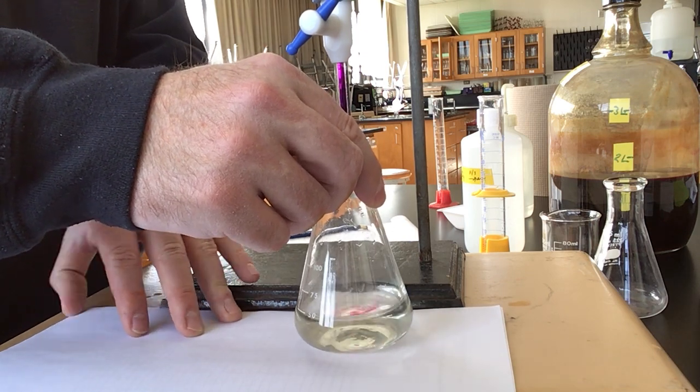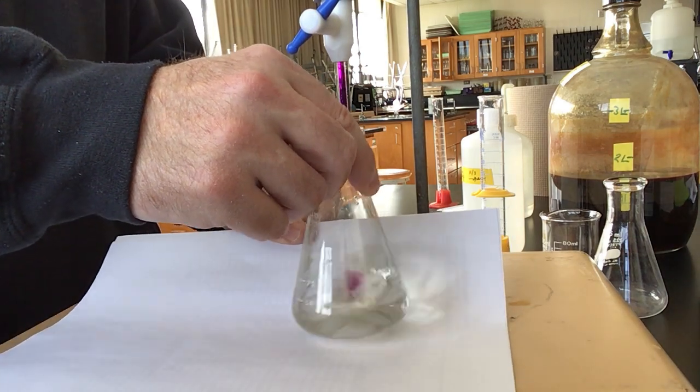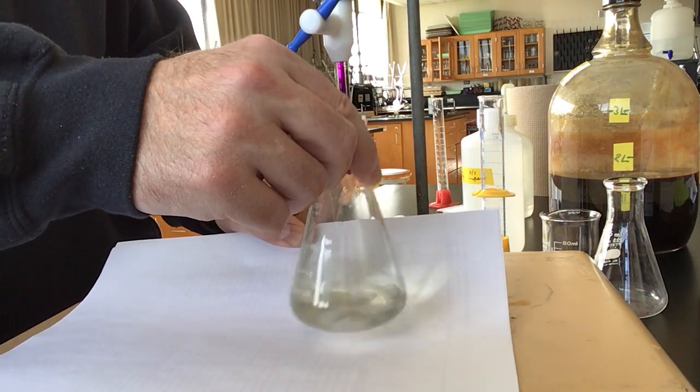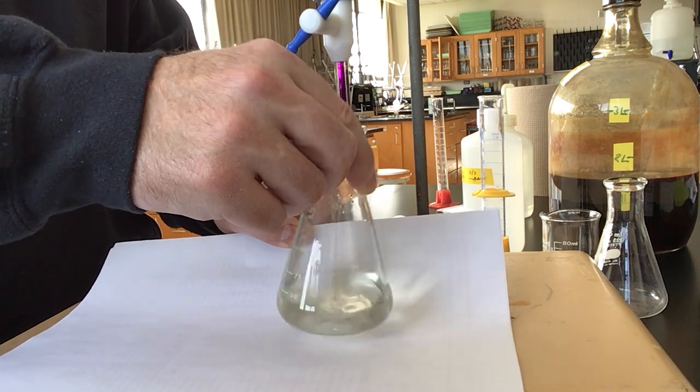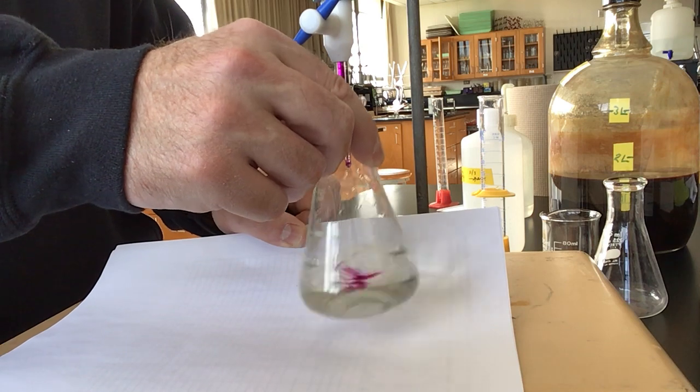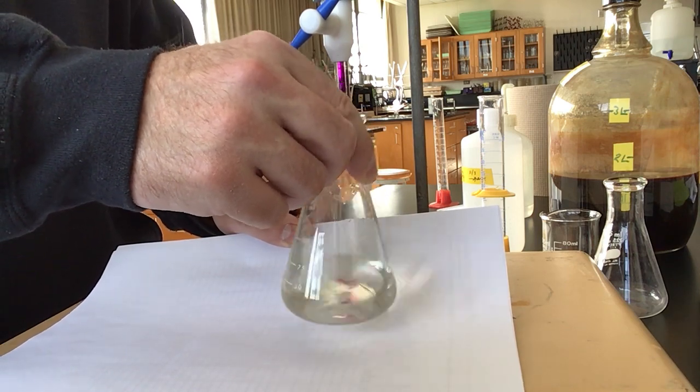Otherwise, what you can kind of notice, hopefully, move the paper here, maybe you can see a little bit better, is that that purple color, the longer it persists, that means that we're getting closer to the endpoint. And I'm adding a drop every couple seconds, so it's going pretty quickly.